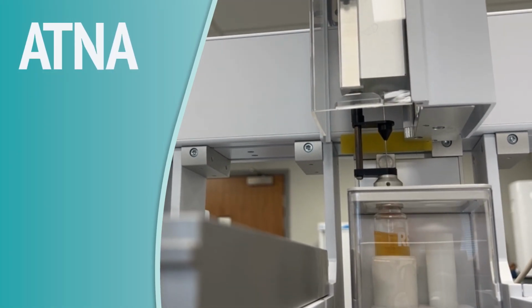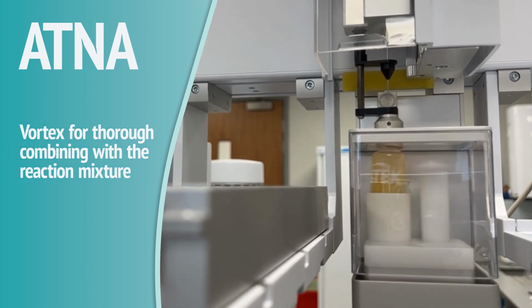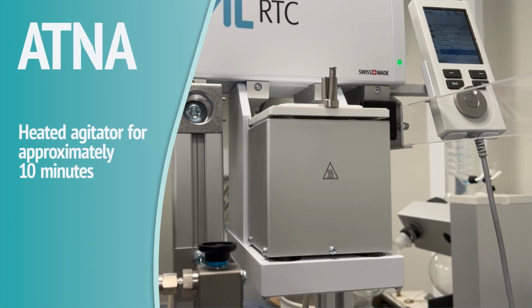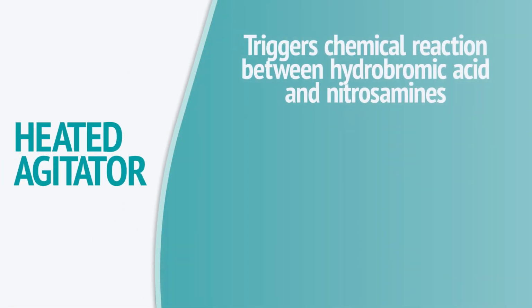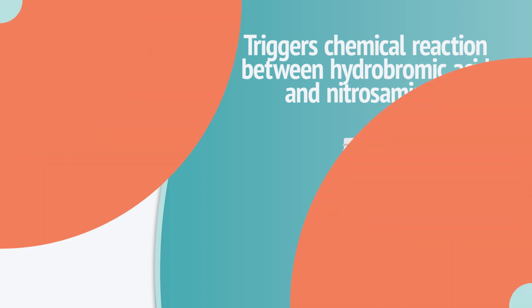optimizing efficiency. The first step of the Automated Total Nitrosamine Analyzer is vortexing the sample to ensure thorough mixing with the reaction mixture. The mixed sample is then transferred to the heated agitator, where it will remain for approximately 10 minutes. This triggers the chemical reaction between the hydrobromic acid in the reaction mixture and the nitrosamines, leading to NO liberation.